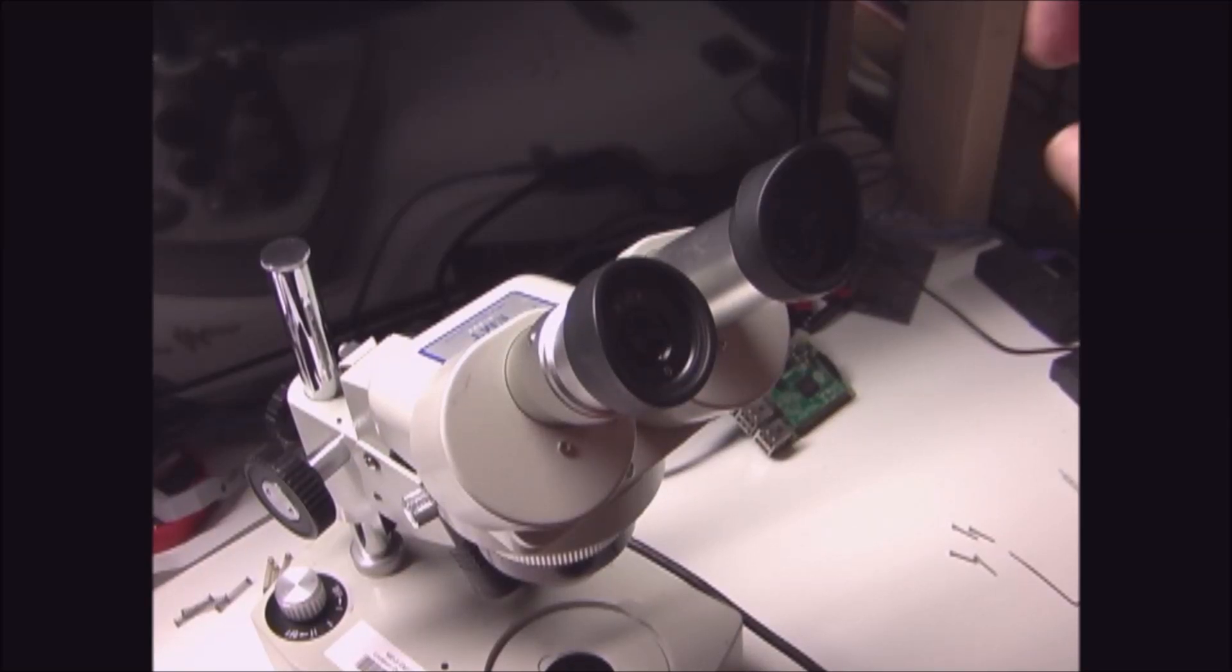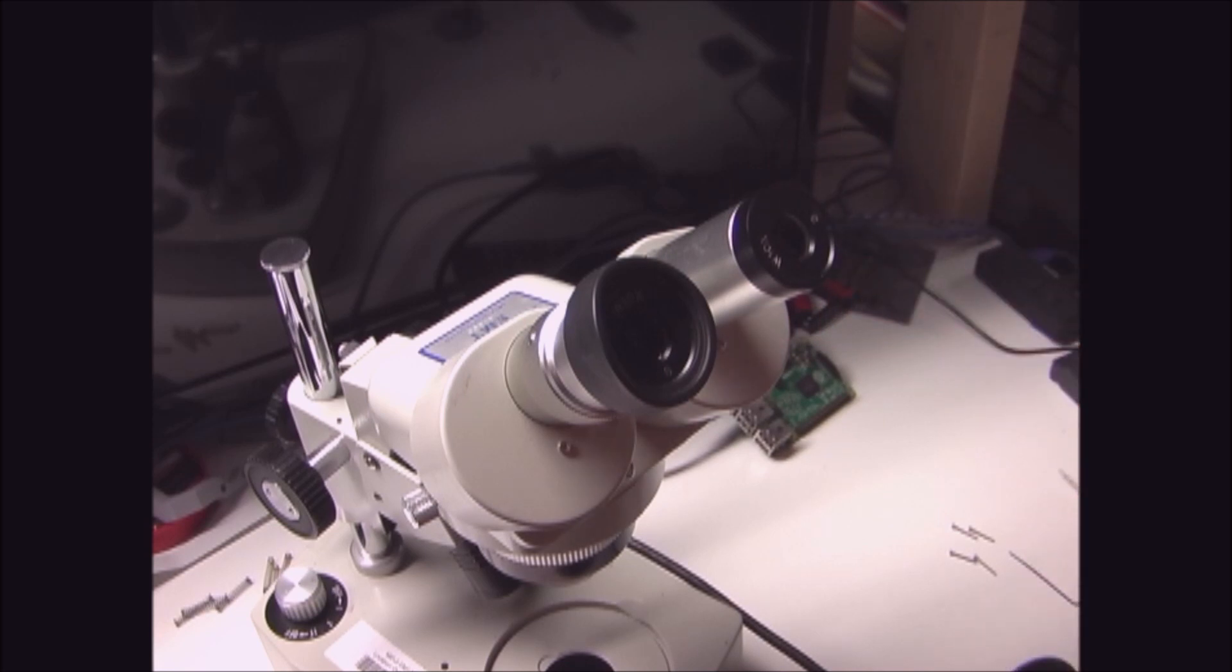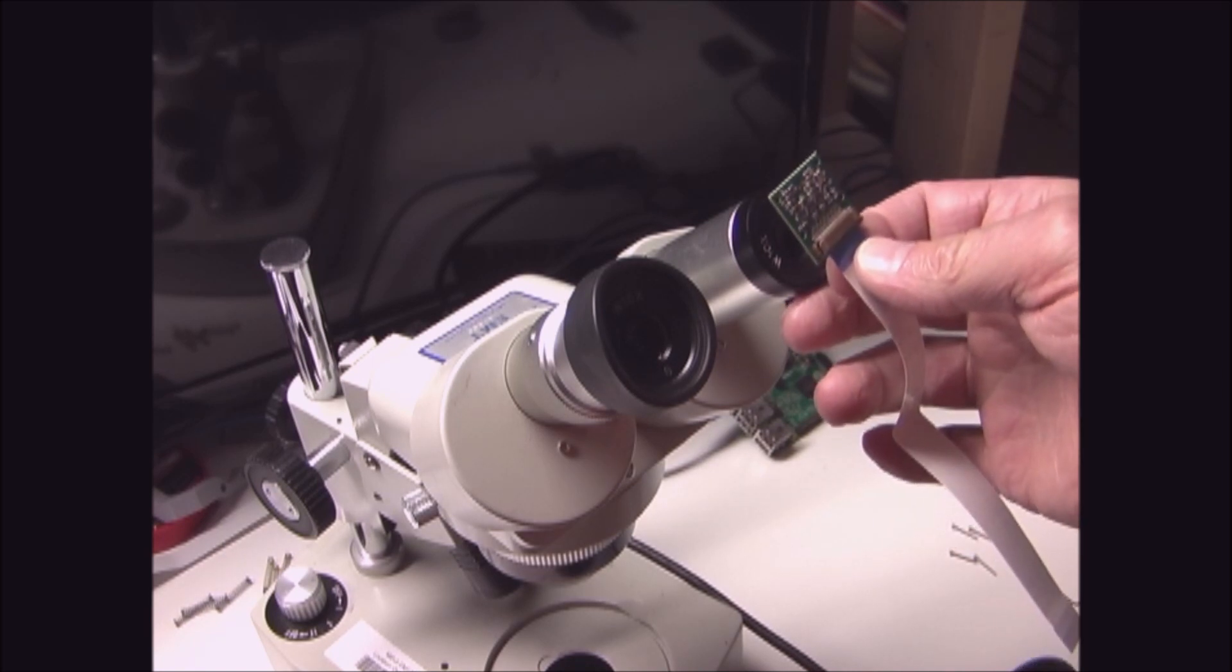I would like to add a Raspberry Pi camera to one side of my microscope. I'm going to 3D print a mount so I can attach the camera above the lens on the microscope.